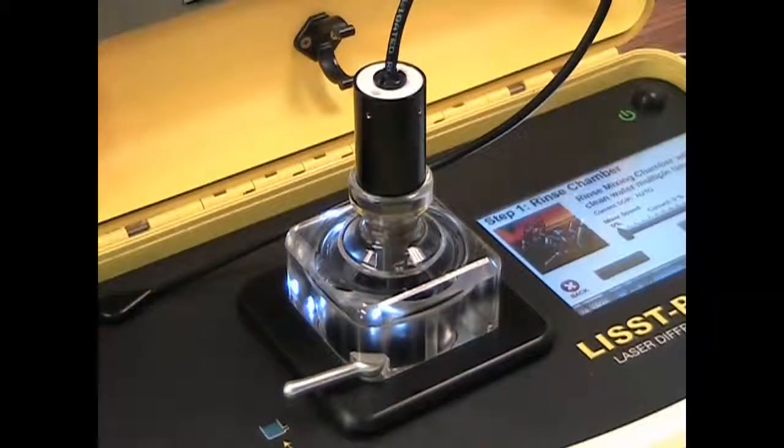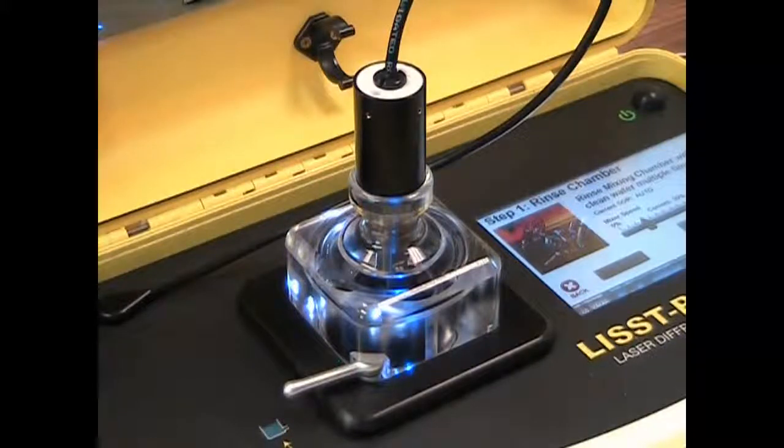When the mixing pump is turned on, the sample chamber should be nearly bubble free. A few small bubbles clinging to the glass at the top of the sample chamber is typically not a problem.